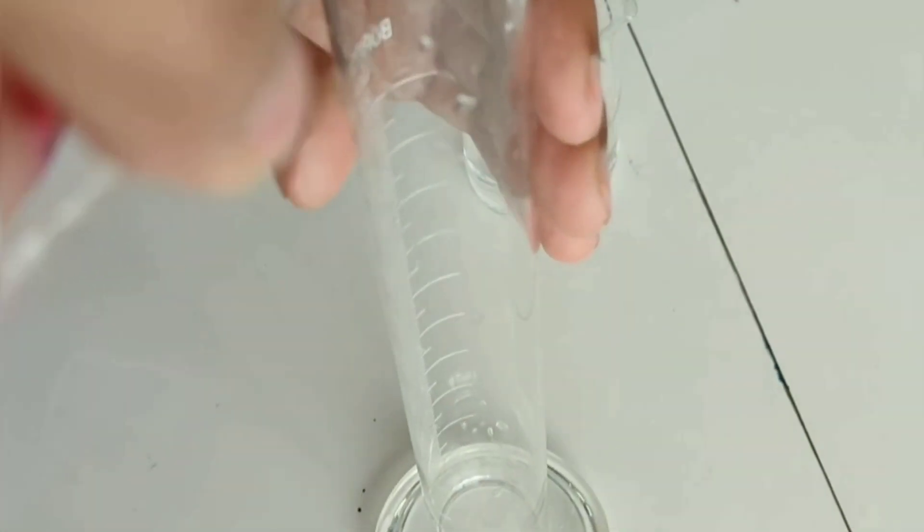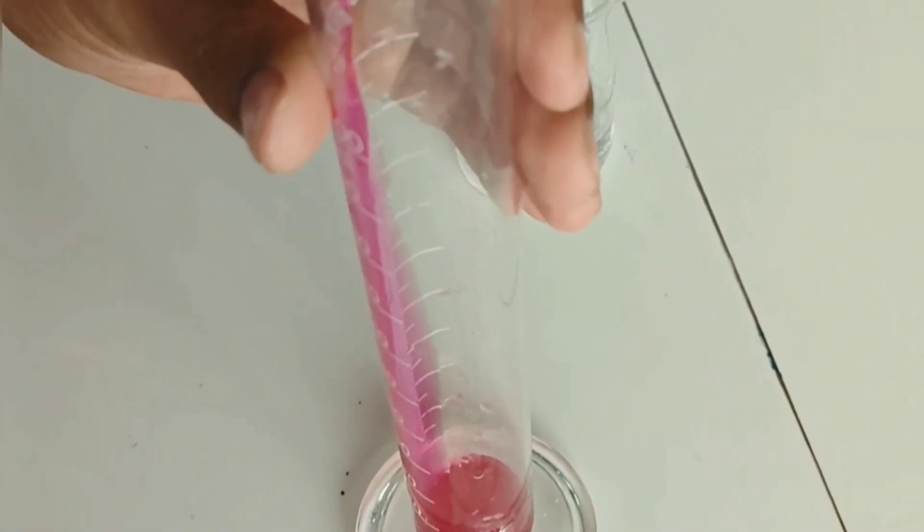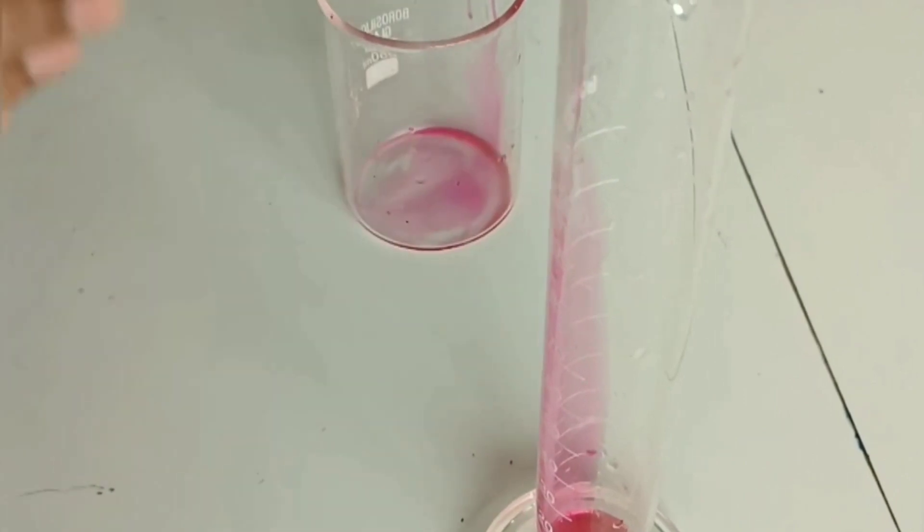And transfer the solution into a measuring cylinder. And make up the final volume using distilled water.